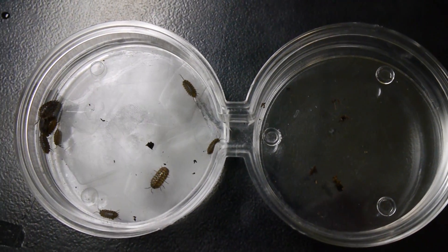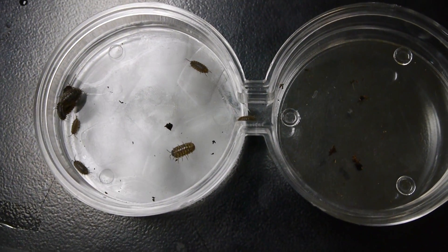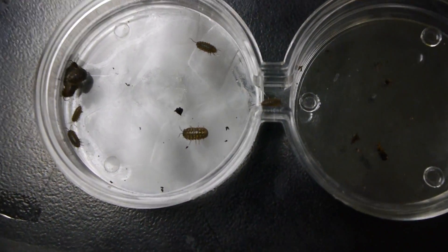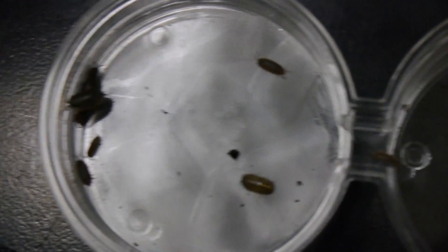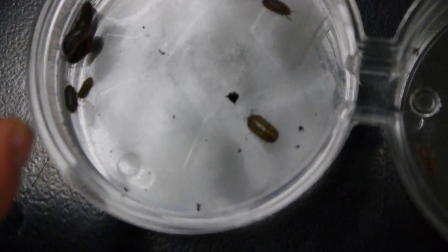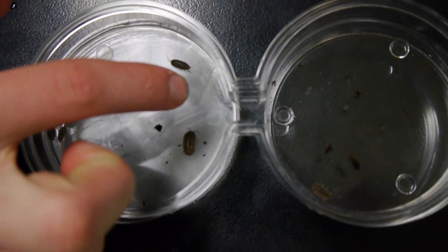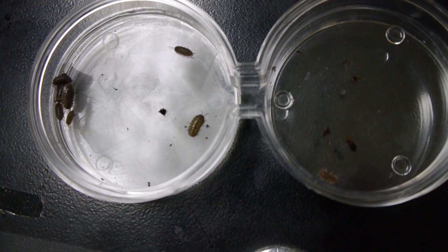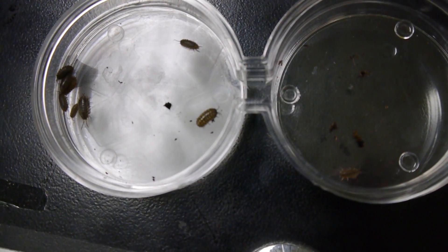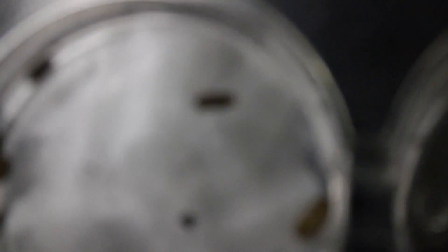I would not have expected that — I thought they would've wanted the warm zones more. They're piling up! They're trying to get out! If you look at it, the cold side actually has water and they're drinking it, it looks like. Shouldn't we put the lid on these things? Because the cold side gets condensation.